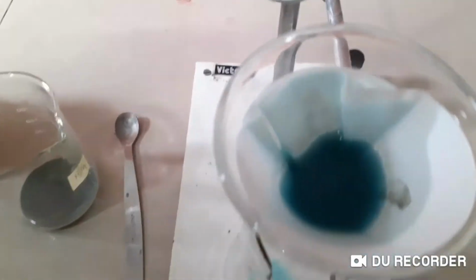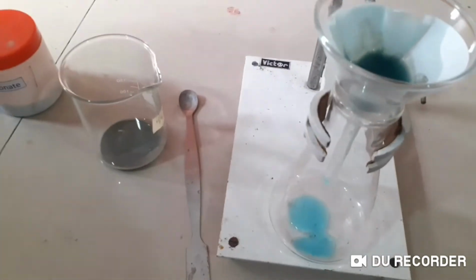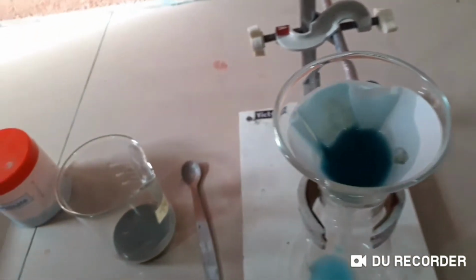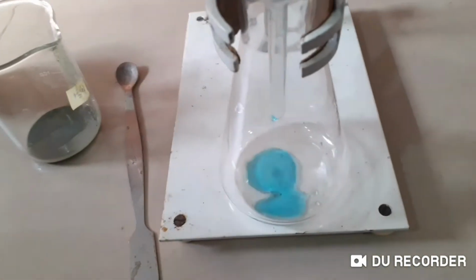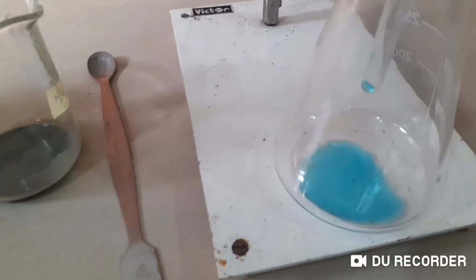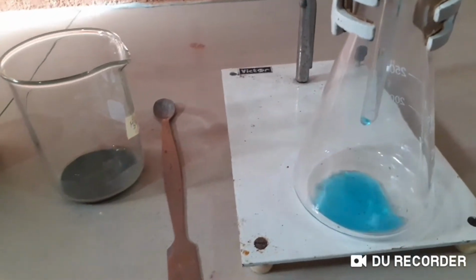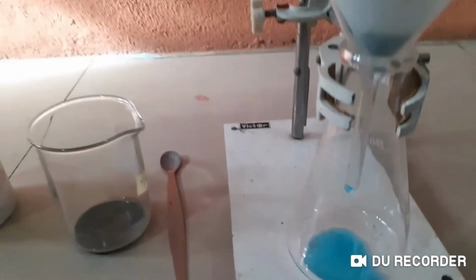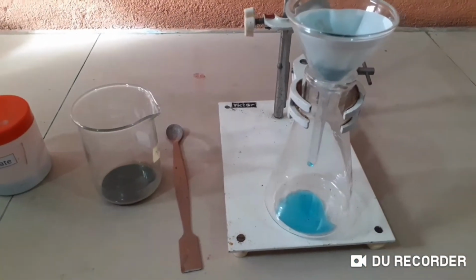As you can see, there's a lot of copper carbonate I have taken. If you want to get this all, we don't actually lift it up and pour it down. A little bit will be formed. That's okay. We are going to make crystals out of that. That's still copper sulphate color. It's not green, no? It's never green, right? That's blue. Getting some more copper sulphate. The color is nice in the video actually. Rather better. Okay, it's pouring. It will take a little bit of time, and now we are going to get that and crystallize.